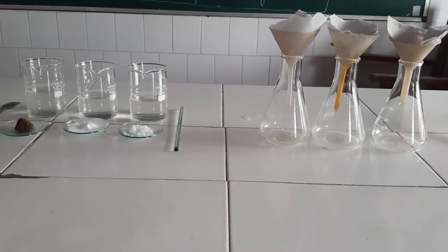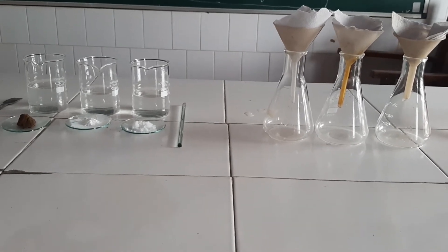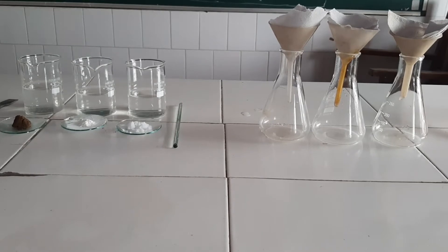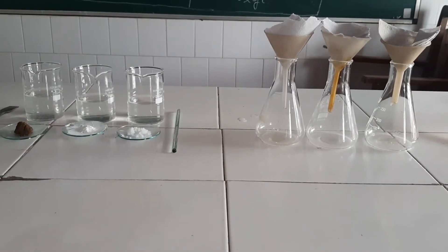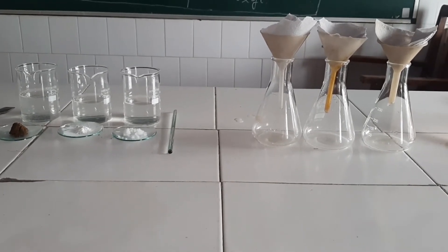If the particle size is very small, the particles will not be visible to us. The solution will appear transparent, it will not show the Tyndall effect, and no residue will be left on the filter paper.